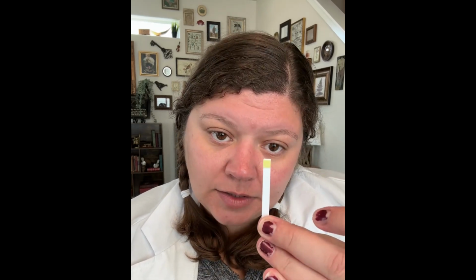As I've mentioned a few times, there are a lot of different ways that you could run this experiment. You could try different brands of the lactase supplement. You could try different brands of dairy products. You could try different kinds of dairy, like different cheeses, yogurts, cottage cheese, etc. You can try different lengths of time, different amounts of lactase. There's lots of potential hypotheses that you and your students can test out with this experiment, and it's very inexpensive and low hazard, since all we're using are these little test strips.